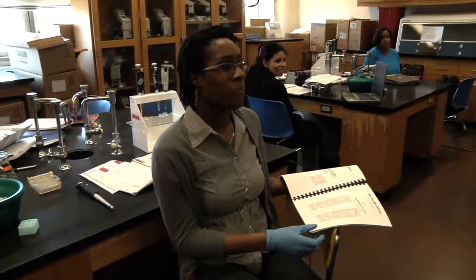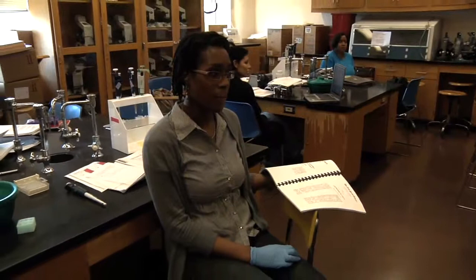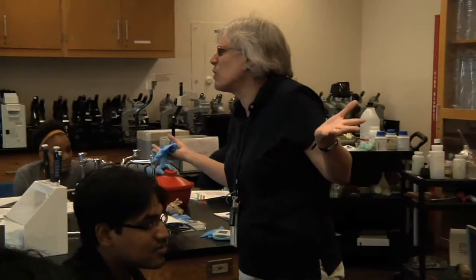What do we have to do with the fish first? We have to extract protein from the muscles of the fish. Muscle is protein — actin and myosin, just like Dr. Actin and Mr. Myosin. So we're going to extract these proteins.